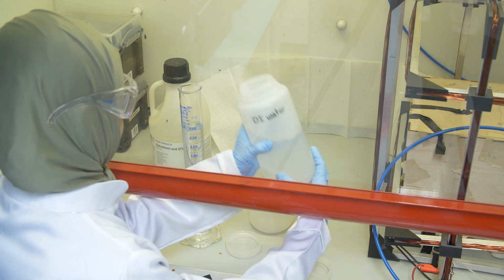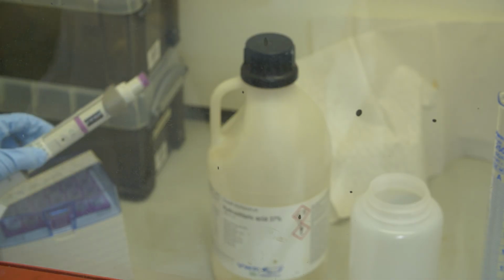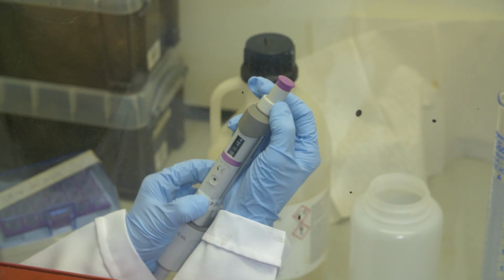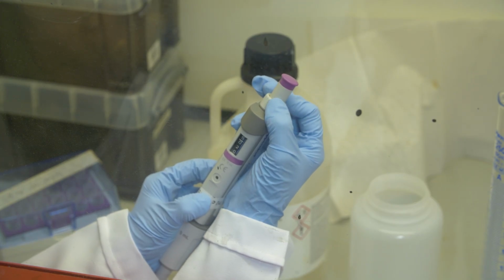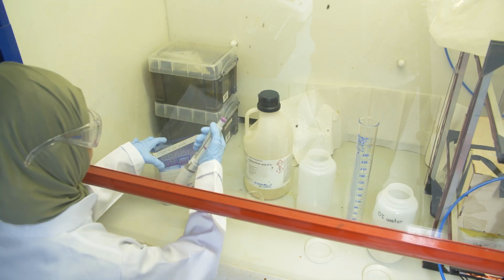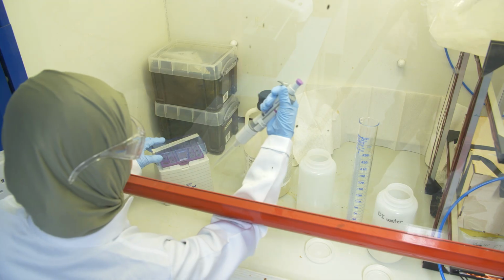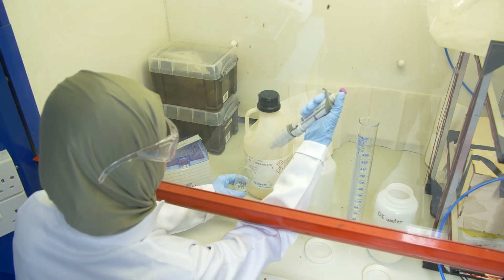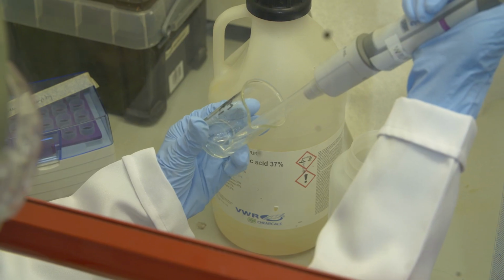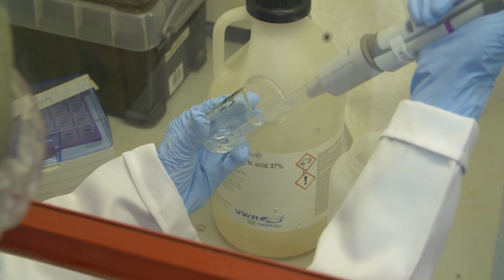You see the screen is between her eyes and the solution, so it takes a little bit of experience, a little exercise, to feel comfortable. Any movement, always do them very comfortably. Here she adjusts the volume she needs. Okay, she needs 1 milliliter in that case, and you see she decanted the HCl into a small glass vessel, so it doesn't go into the original solution.